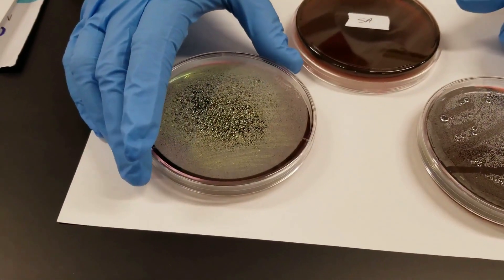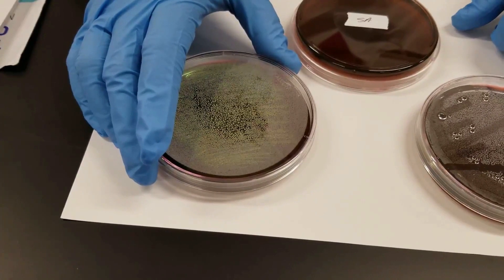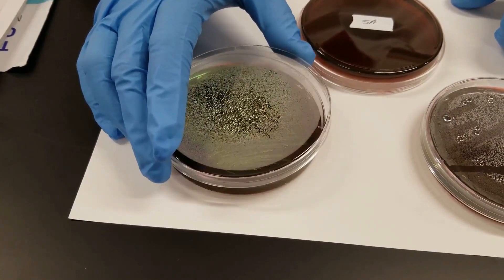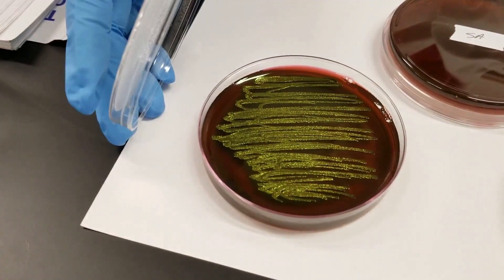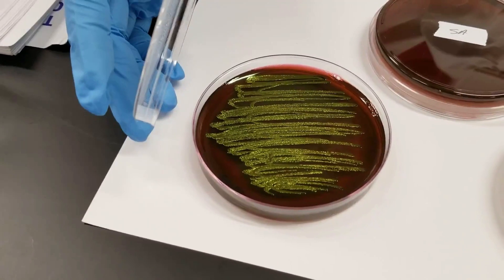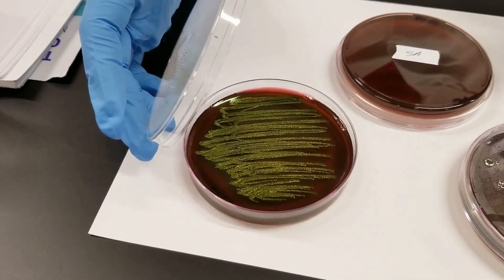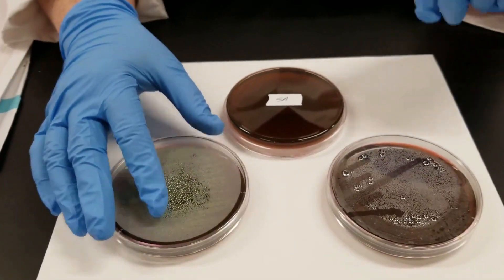This plate is E. coli. You will notice there is a very classic coloration — it's a metallic green. It's actually very distinctive. When you see that metallic green coloration, you know that's E. coli. That's the only one that's going to turn that color on EMB.